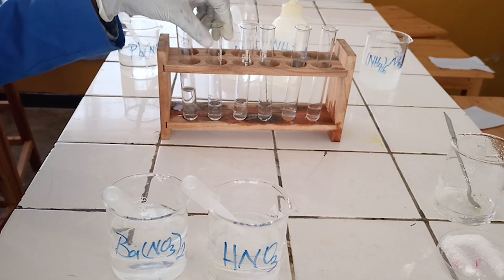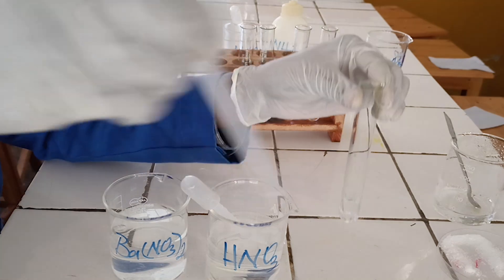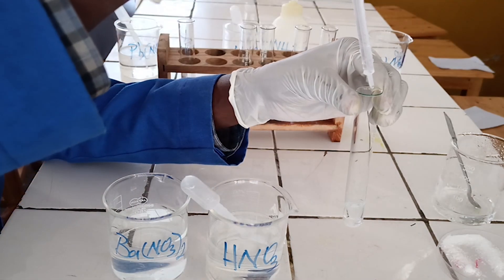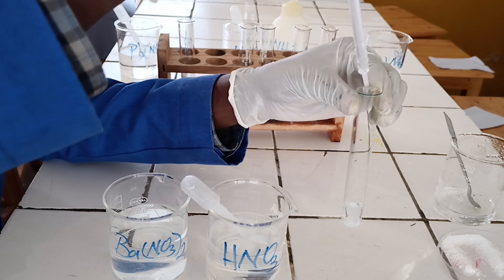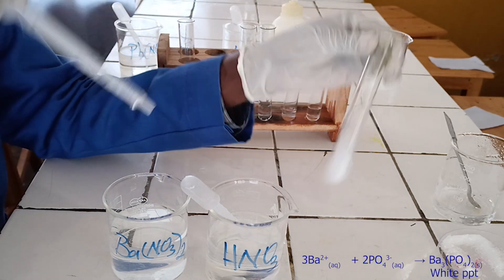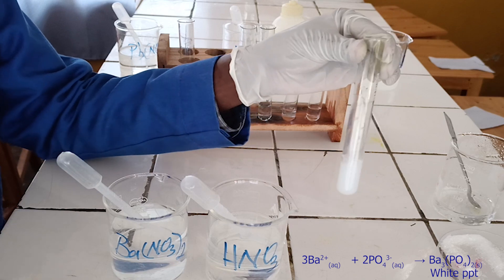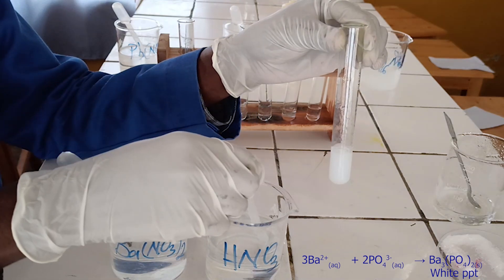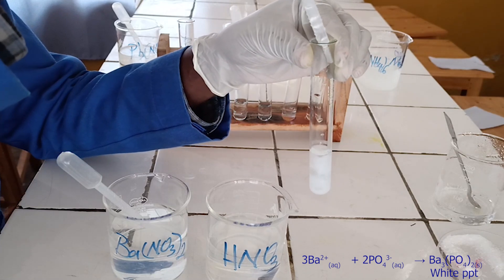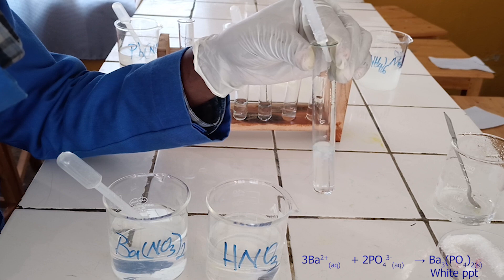To the second test tube, add barium nitrate solution followed by nitric acid solution. As you see, barium nitrate reacts with phosphate ion to form a white precipitate. The precipitate formed is soluble in diluted nitric acid without effervescence. Below, there is the ionic equation for this reaction.